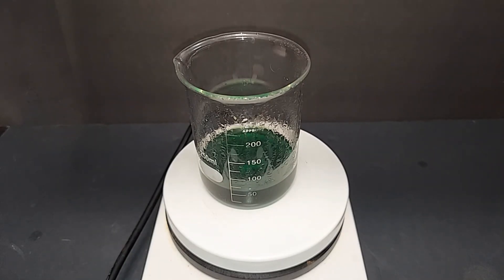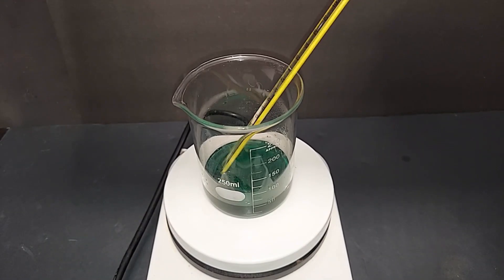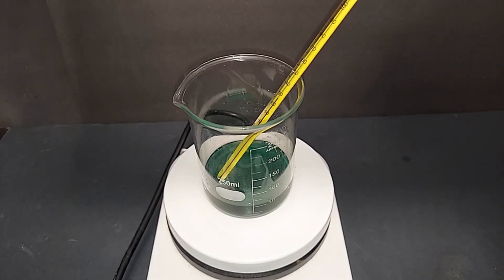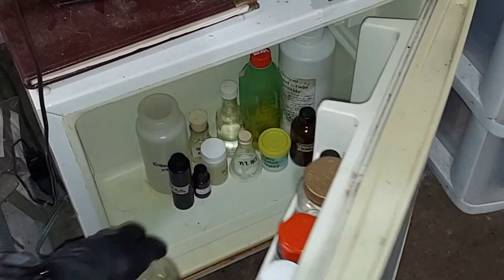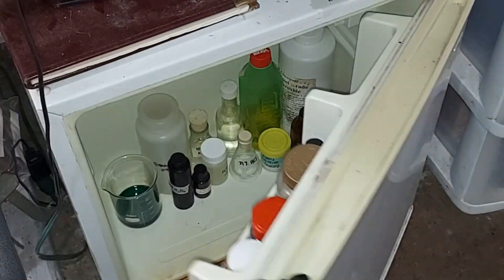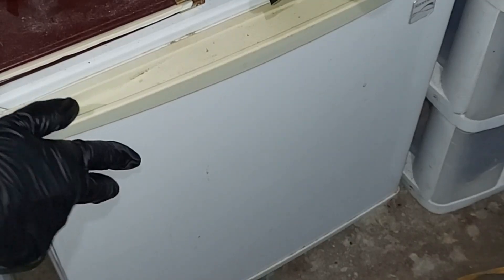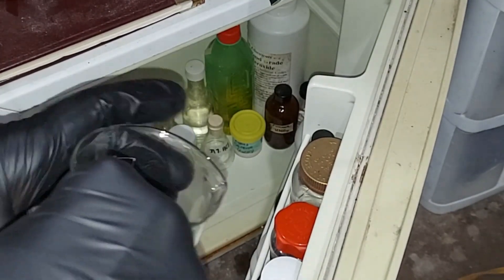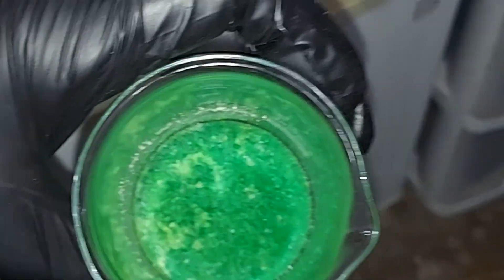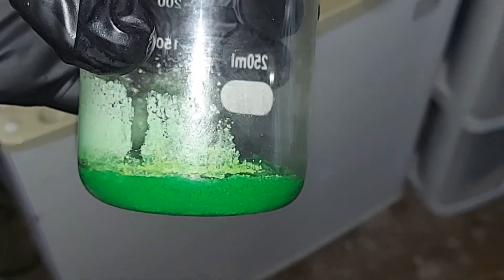It's been about 45 minutes but it's cooled down to about 25 degrees Celsius, and that's room temperature where I'm at. So let's go put it in the fridge. In it goes. Time to take it out—it's been in here for about 3 hours. I also did a few things to it in the meantime which I didn't show you, but I'll explain. But look at that, there's our nickel chloride hexahydrate.